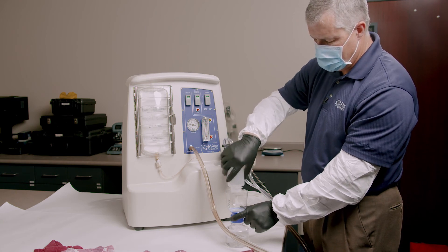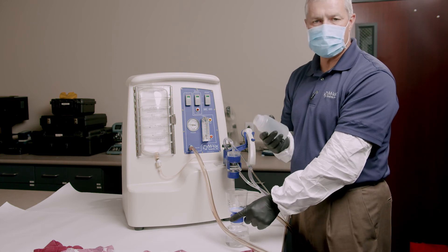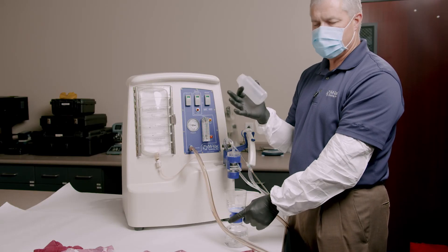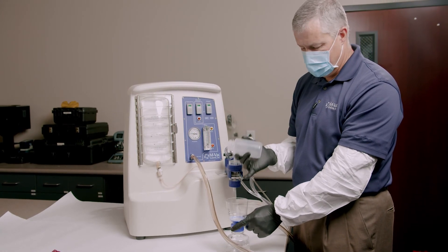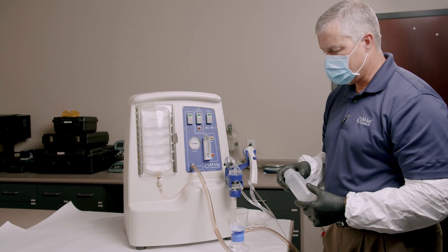The key point is it doesn't really matter how much liquid you have after the sample. Unless the sample itself is really dirty, the filtering doesn't take very long. You get rid of the majority of that liquid, and even if your total sample is a liter it wouldn't really matter because it can all be filtered through this 0.45 micron filter.